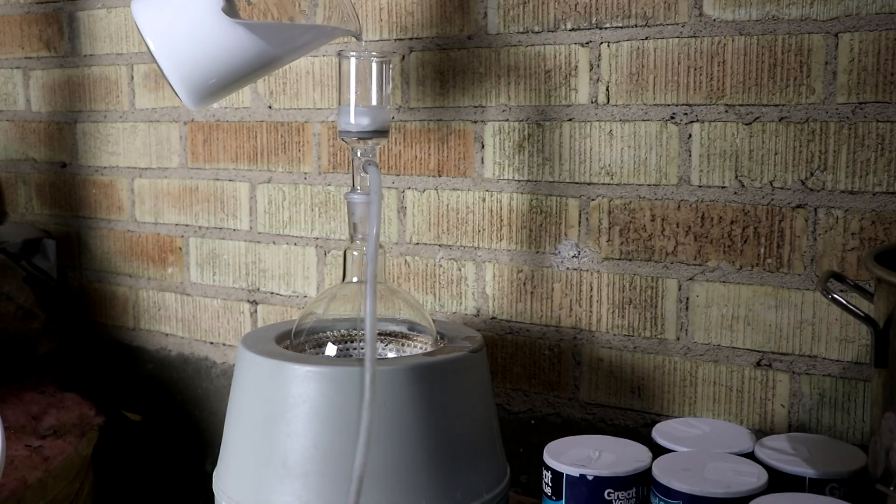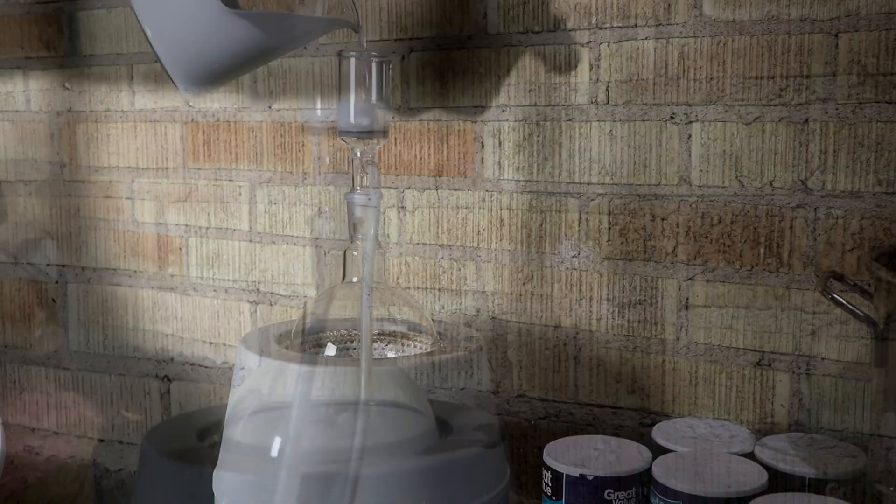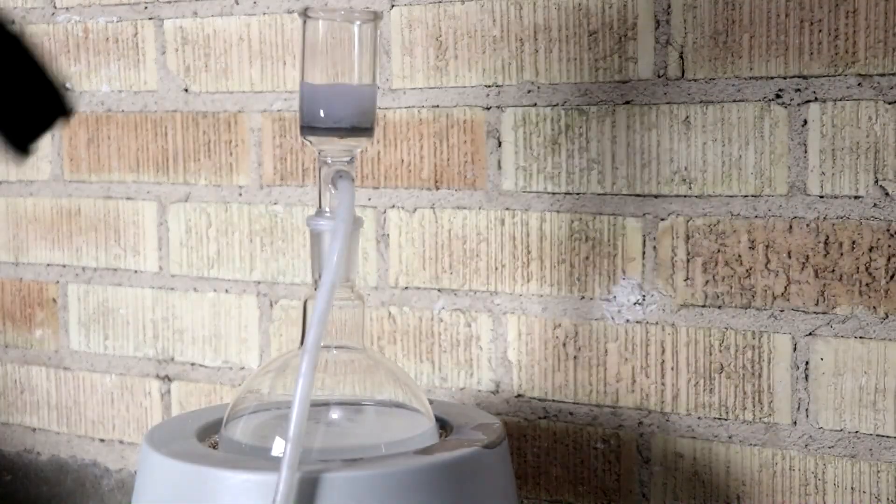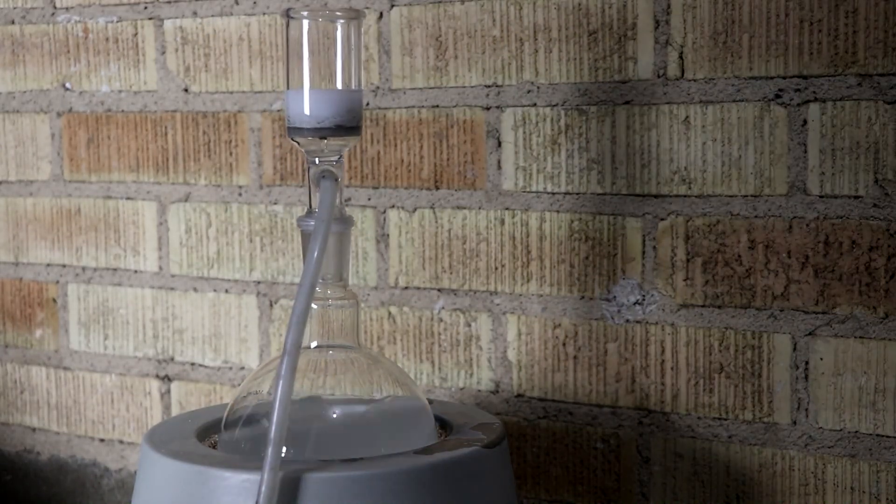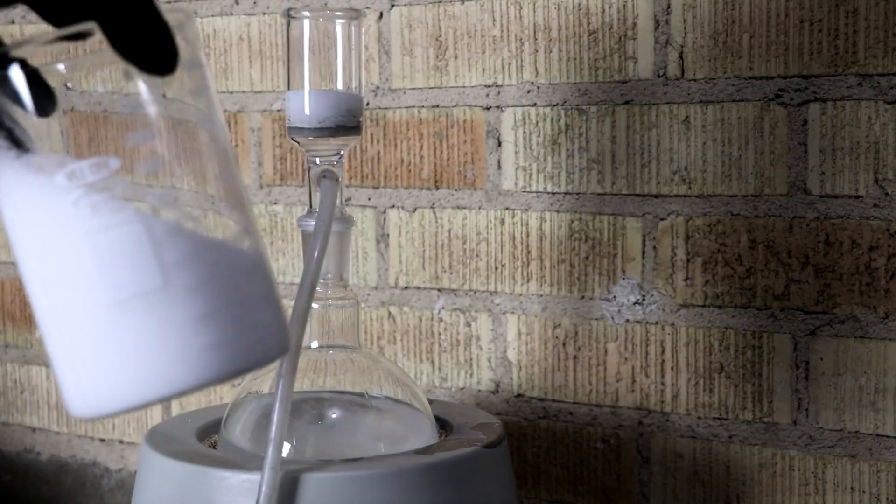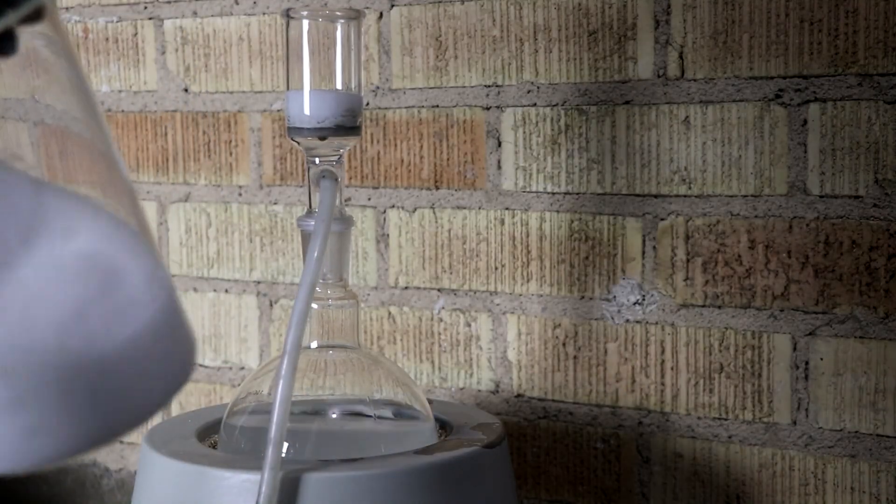Okay, now that I'm pretty sure that all of the iodide has been dissolved, I'm going to take the acetone and pour it through the little vacuum filter into a one liter flask. This is to remove the anti-caking agent.